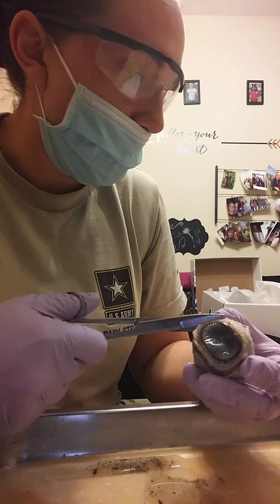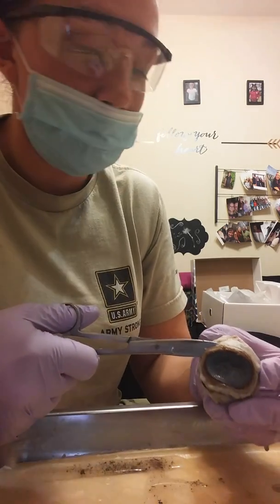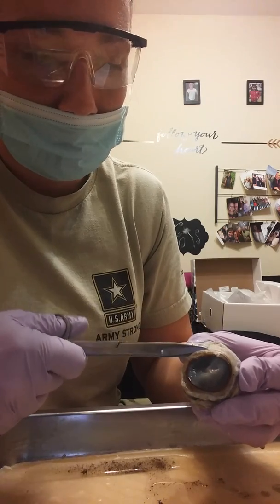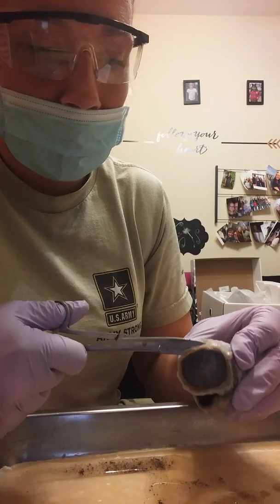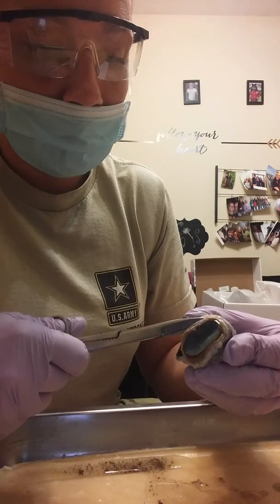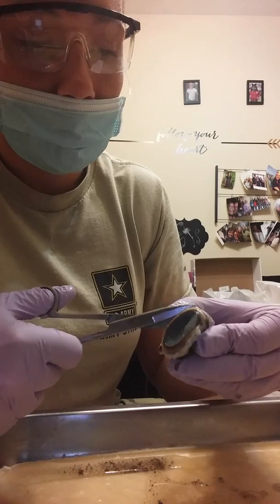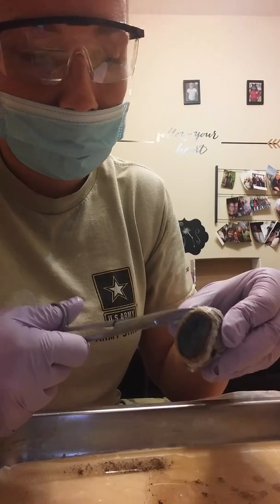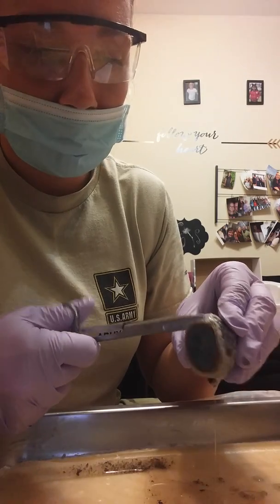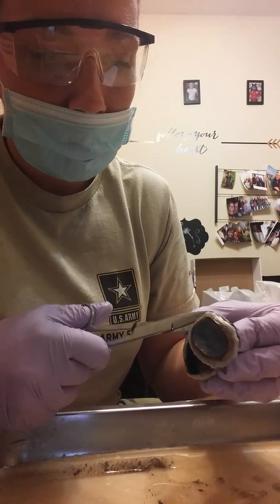Alright, and then to answer the other questions, what happens to the diameter of the right pupil when you briefly shine the flashlight into the right eye? So I have to do this all the time at my job doing physicals for patients, and when you shine light into the eye, you can visibly see the pupil constrict. And when you shine light into the right eye, the left eye also constricts along with it. And then it would be vice versa. If you shine light into the left eye, then the right eye constricts as well.